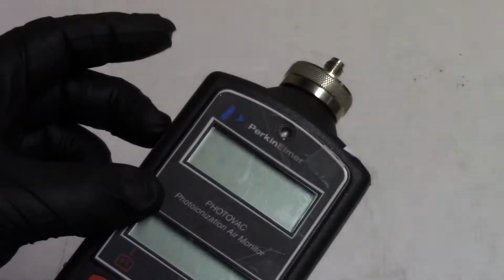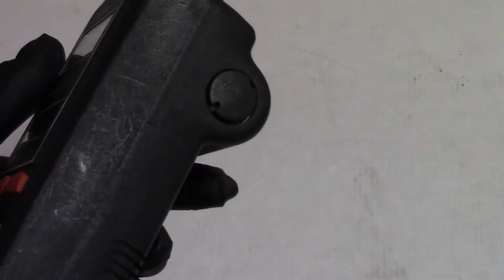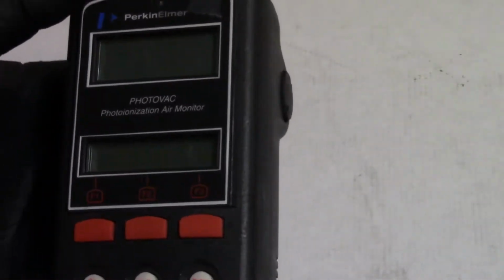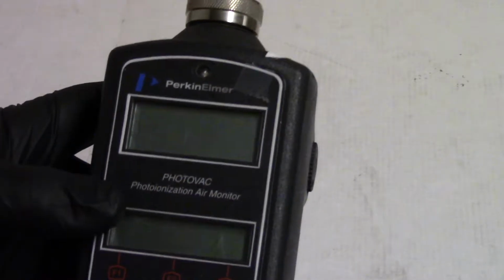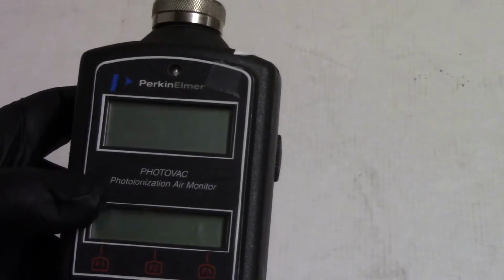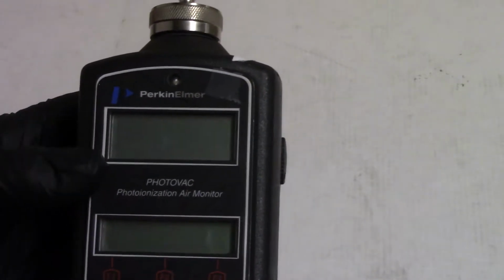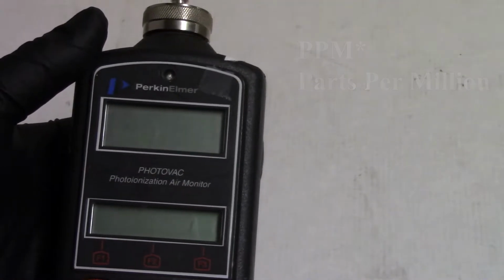This is the sticker from the eBay seller that I got it from, so I'm just going to peel that off because it's kind of in the way. But you can see it has two LCD displays on it. One will list the volatile organic compound amount, and then some other functions down here, memory and whatnot.